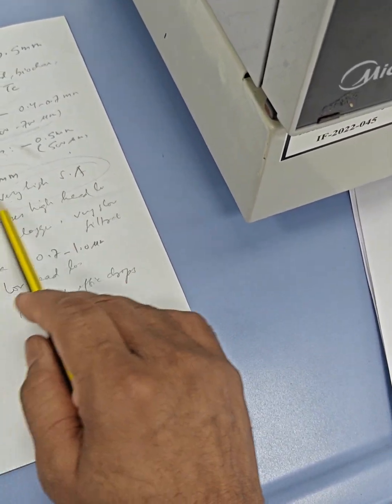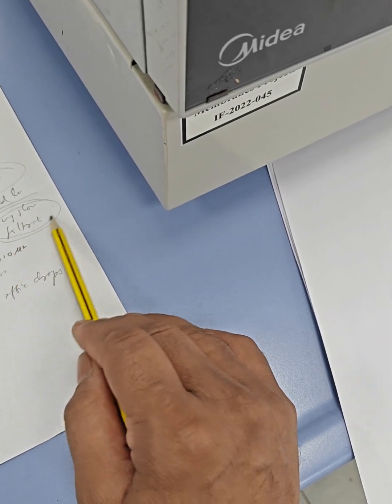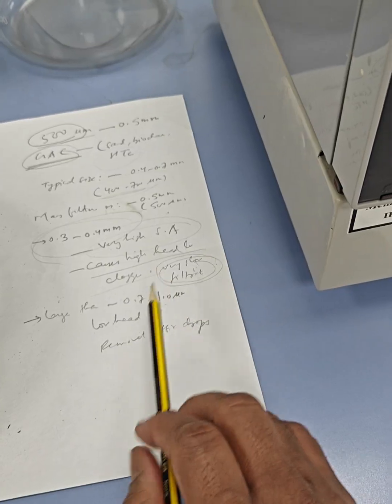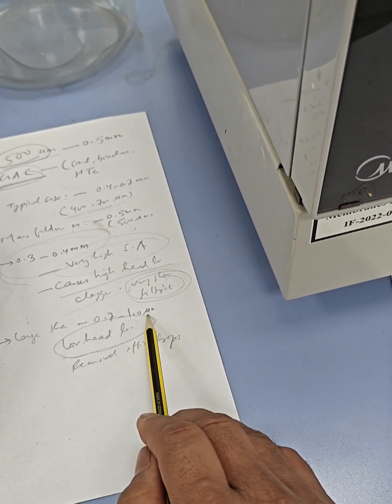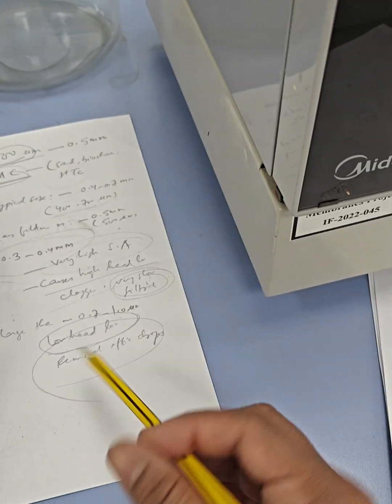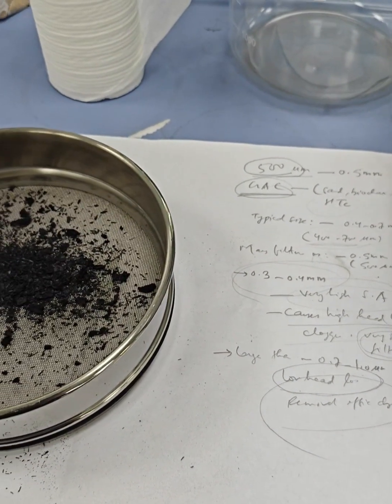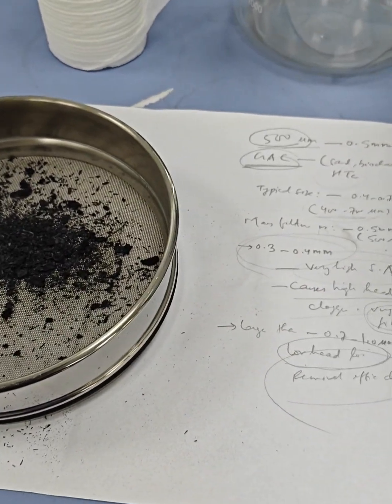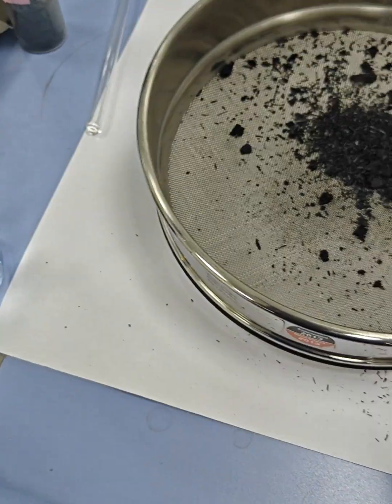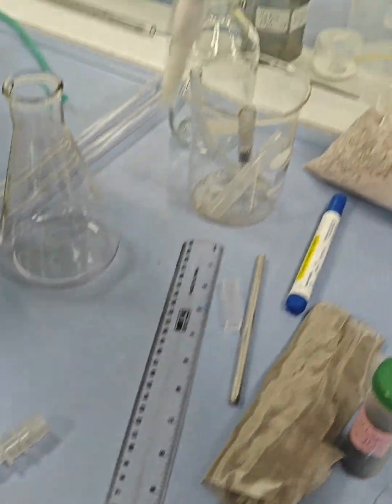If you want a very high surface area, the particle size could be low, but it could cause high head loss, clogging and very slow filtration. If you have a larger size, you could have low head loss, but again the efficiency depends on the type of material that we are using. We will use certain equations to find out the mass of the particles. Usually the mass of the particles is not fixed, it totally depends on the height of your column.